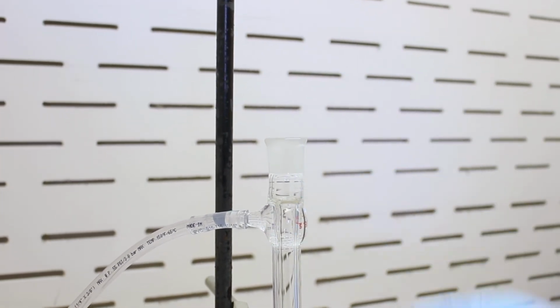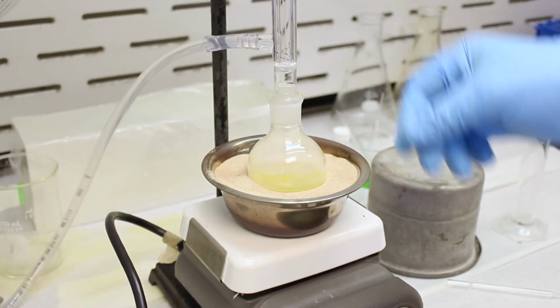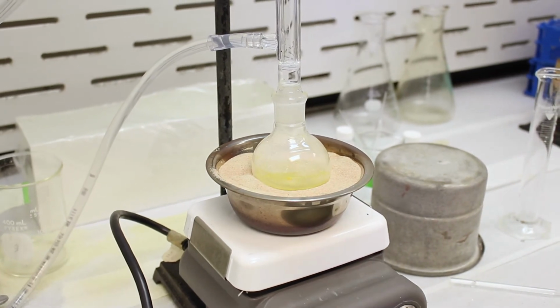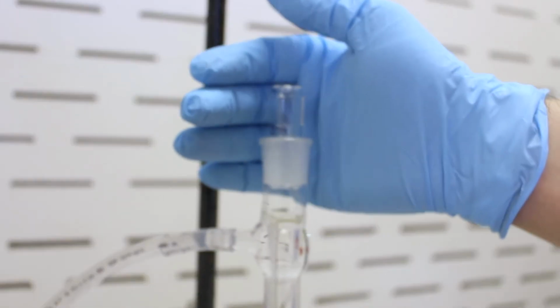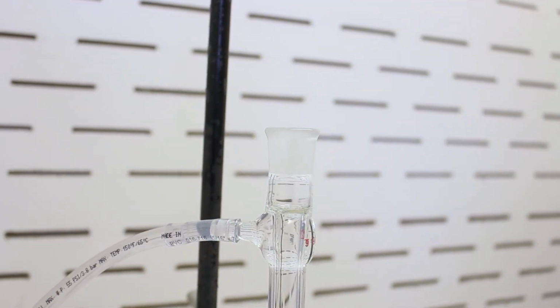You don't want to do that, because when you do that, you create a risk of pressure building up in this apparatus. So gases or water vapor may build up in a pressure such that the apparatus explodes in a worst case scenario. So you can even see a little bit of pressure. I don't know if you saw it, but the stopper maybe popped up a little bit. Maybe it won't do it again. So there, you may have been able to see it raised there. So do not stopper that, and everything will be safe.